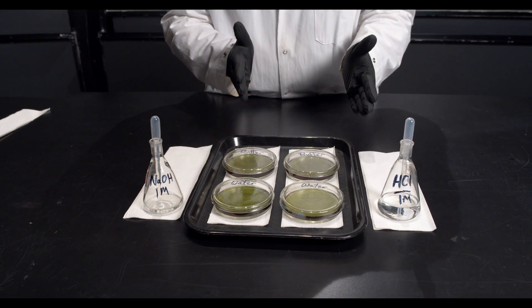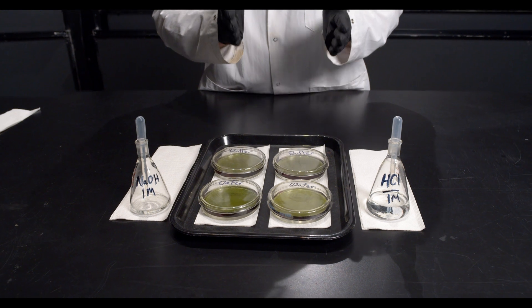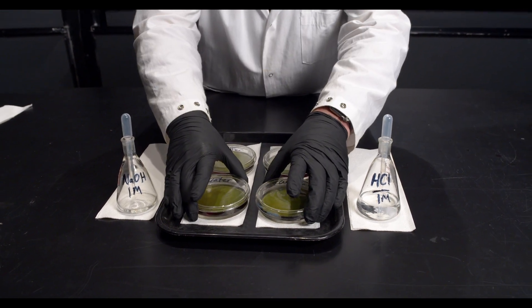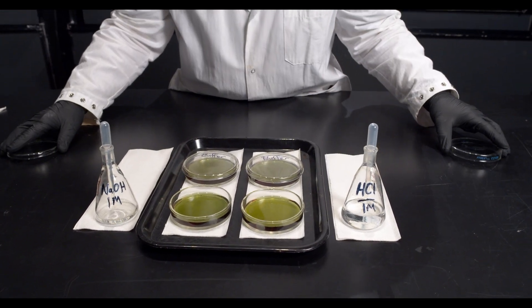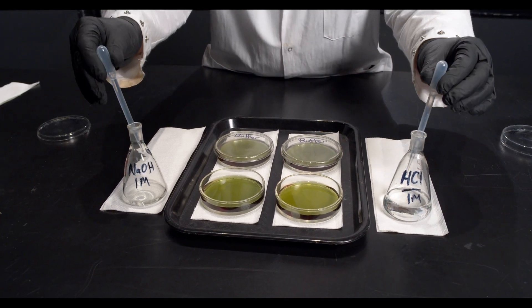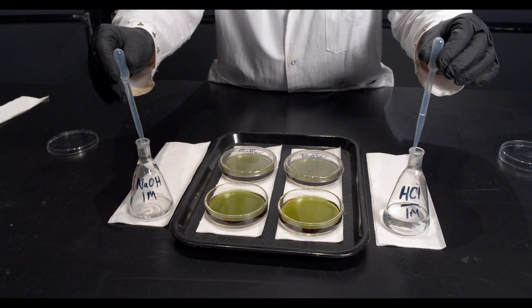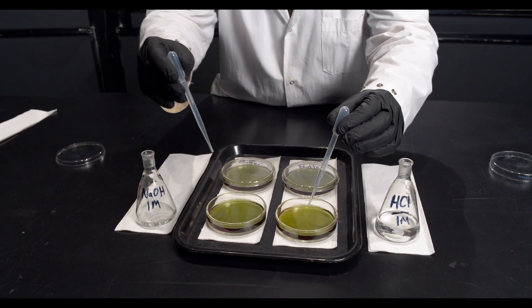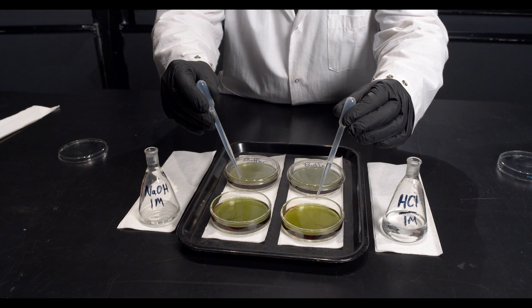And we're going to observe that pH change by observing the color change. I'm going to start off with the water and I'm going to add a drop each of acid on the left, on my left, and base on my right.